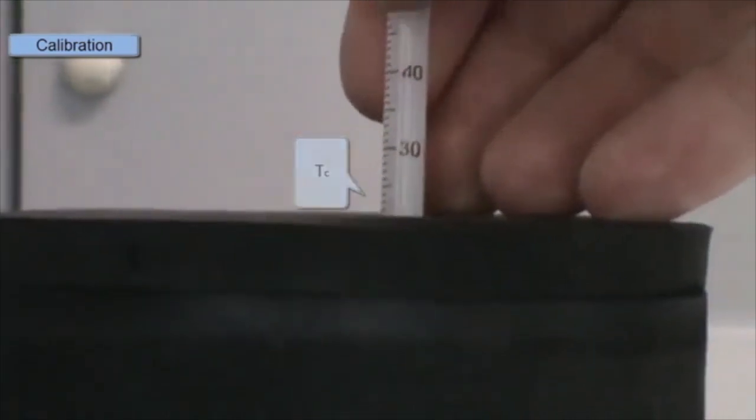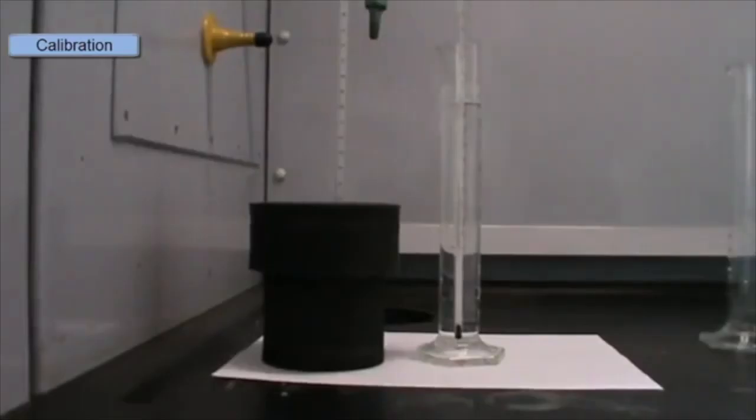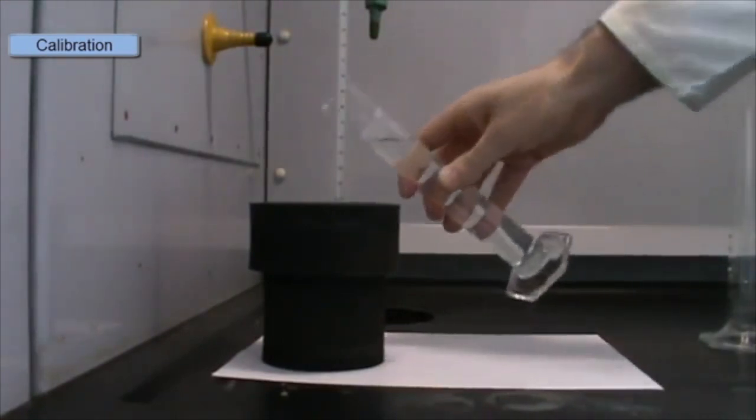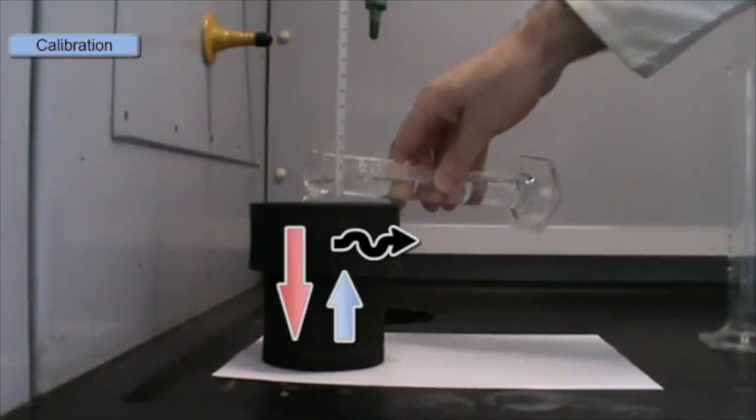So in this experiment, the cold water is going to gain some heat, the warm water is going to lose some heat. So we'll pour in our warm water. And after mixing, we'll note the temperature of the solution.